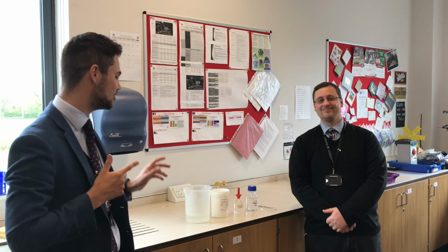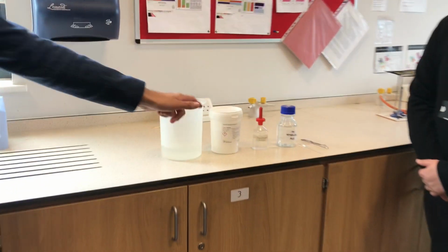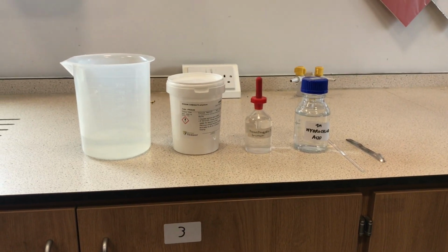Today we're going to be looking at colour changes in chemistry. In front of us we have sodium carbonate, phenolphthalein and hydrochloric acid. Now, Mr. Walker, what are we going to be doing with them today?